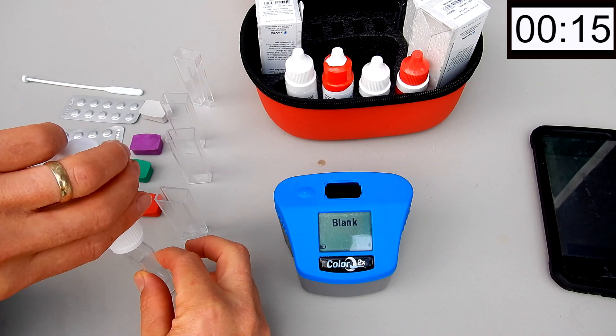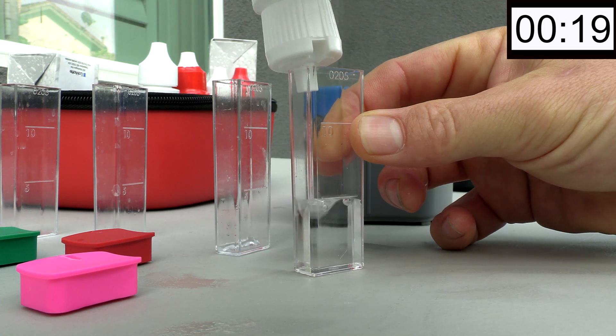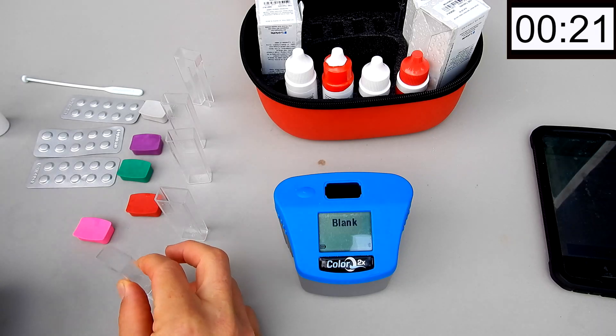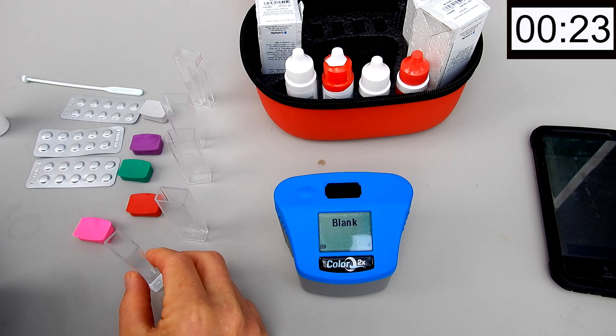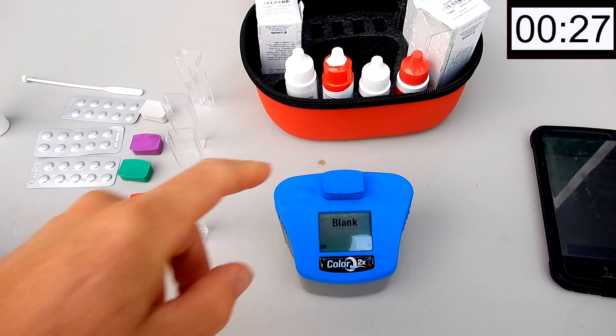I'll fill the first tube up to the 5 ml line. Let me go ahead and blank out the unit.